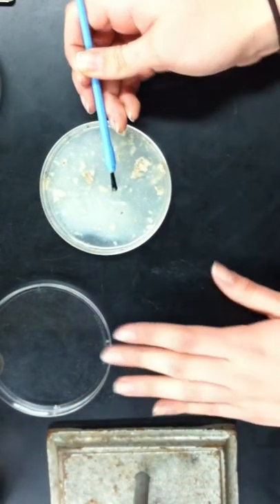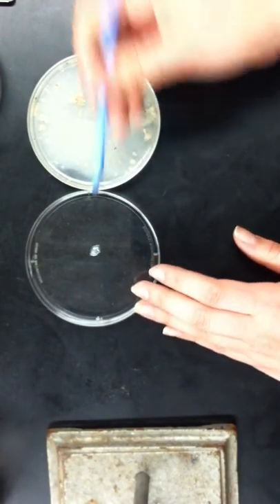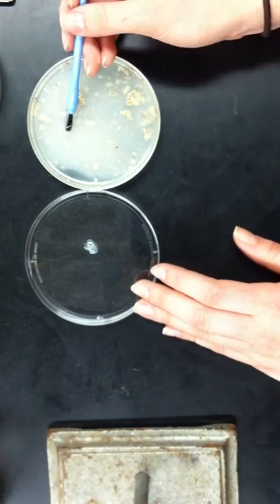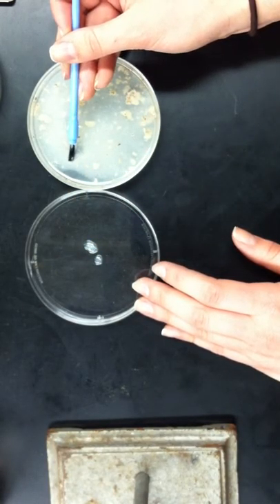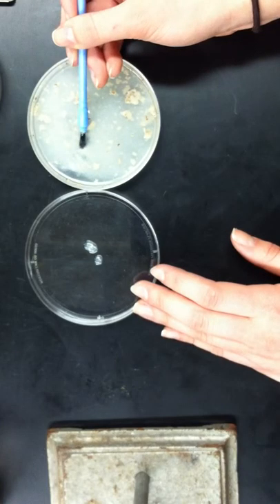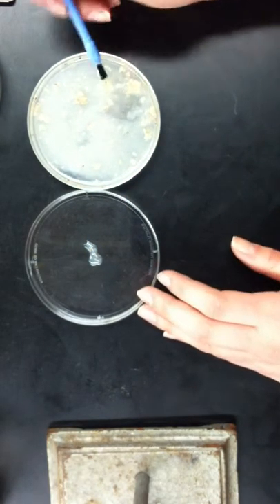Now, one by one, you're going to pick the larva and put them into the smaller half. At first, it may take a while, but after doing it a few times, it becomes a lot easier. They kind of stick to the bristles of the brush. That's why we use the brush instead of any other type of metal utensil.